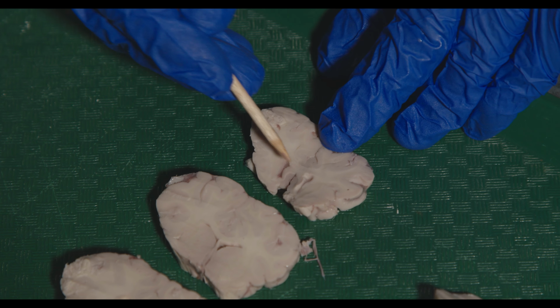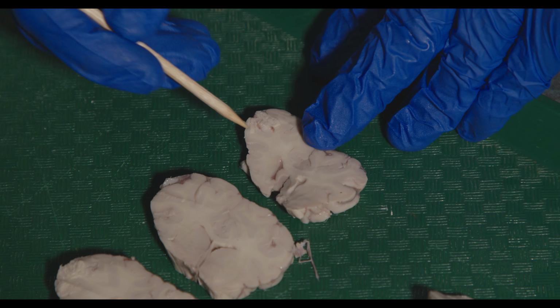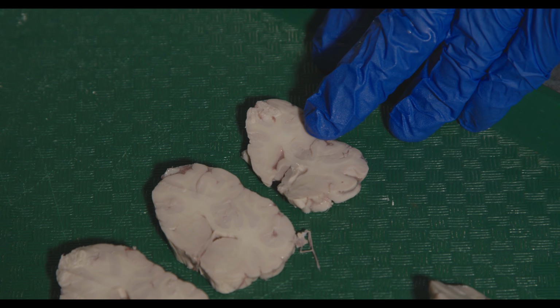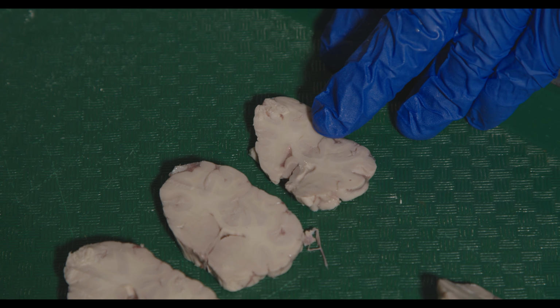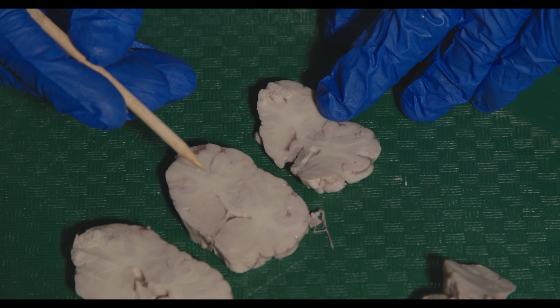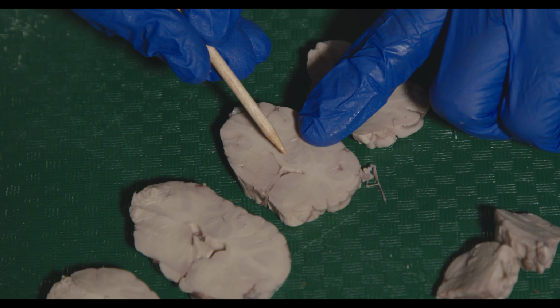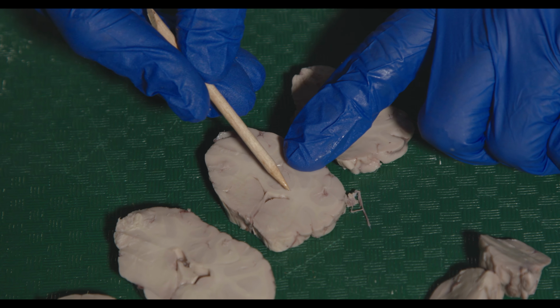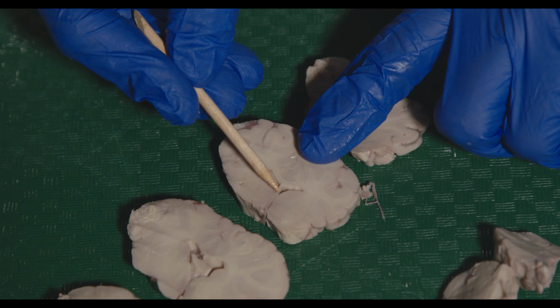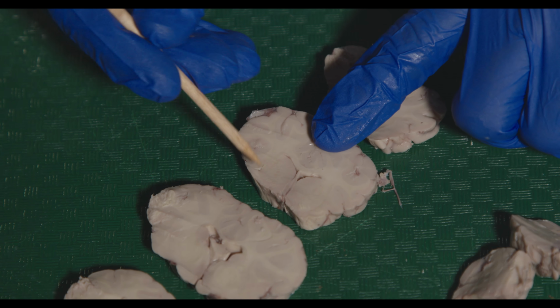You can't really see it too well on this one, but essentially we're going to start forming some of the caudate and the putamen, which you can see on plate 9 of your lab manual. We can see them a little bit better if we go a little further back. So this is a little bit more caudal. Again, we can see the corpus callosum, and we start to see a little bit of the septal nuclei, but that's not important for our purposes.